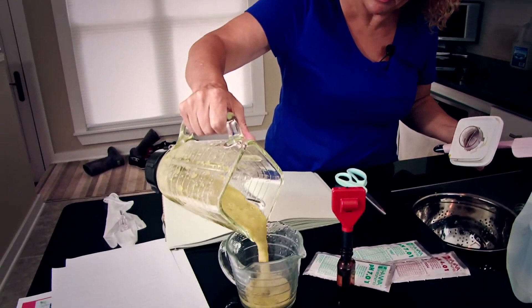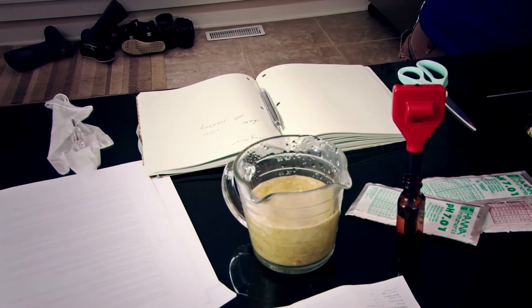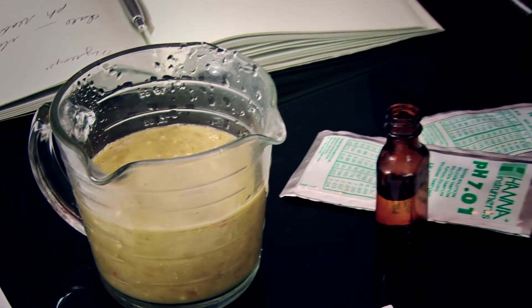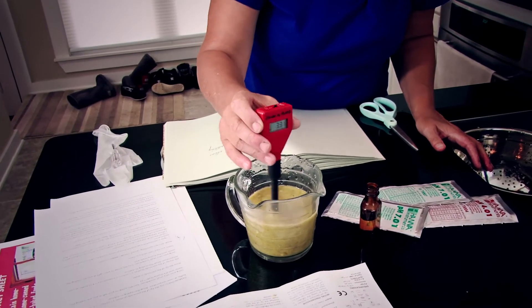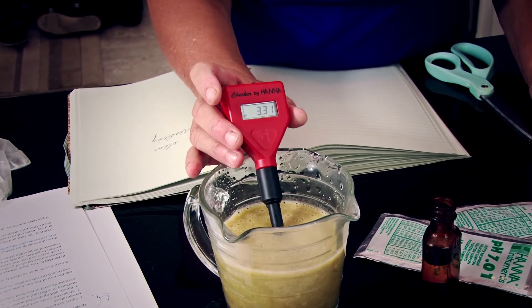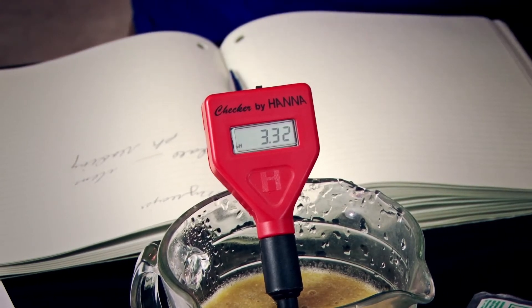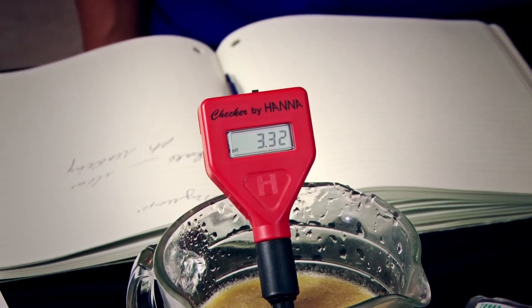I'm going to add a little bit of distilled water to this. As you can see, I got something the consistency of pea soup. I'm going to give this pH meter a little rinse so that it doesn't have any of the buffer solution on it anymore. And we are going to drop this into the slurry and swoosh it around a little bit, and then let it rest. Do not get the top part of your meter wet — it's just not a good idea. The electrodes can get wet and they can also be replaced. As long as you keep your meter safe, dry, and stored in the dark, you should be able to use this meter for a very long time.